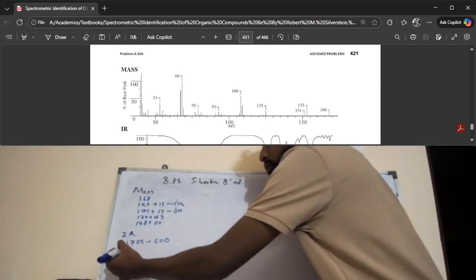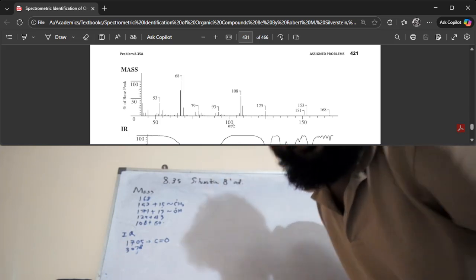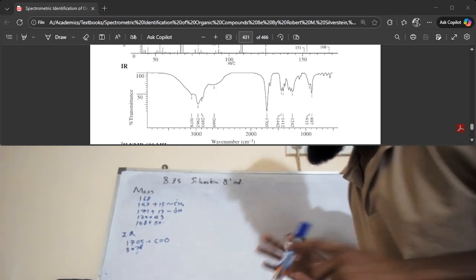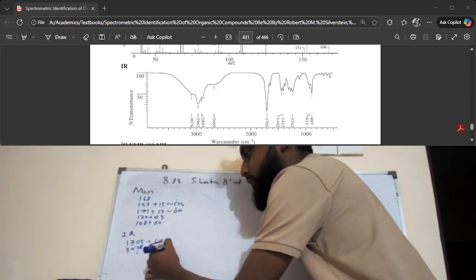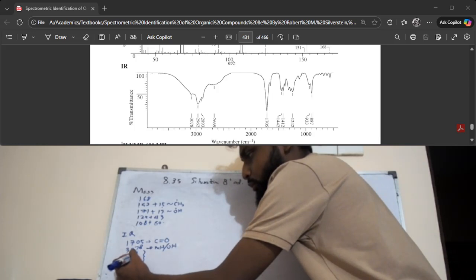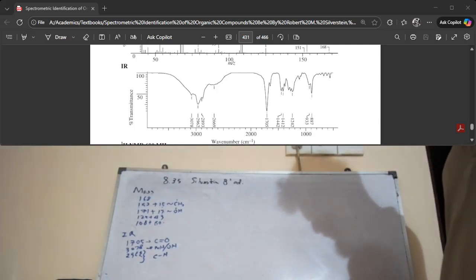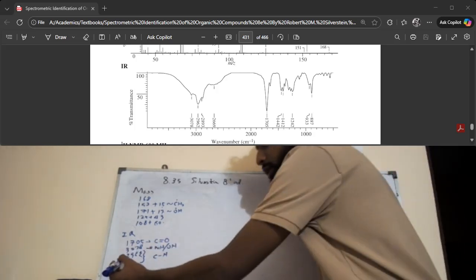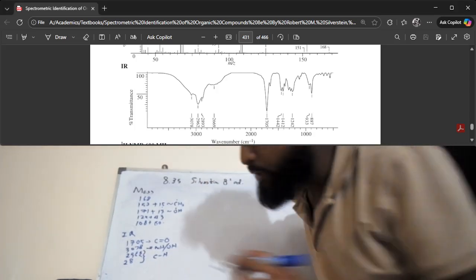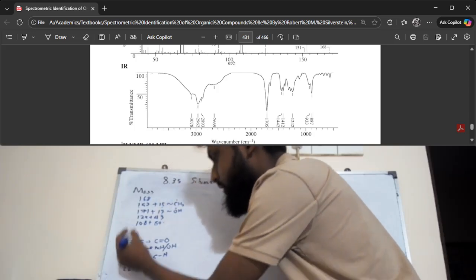There are a bunch of other peaks in the 3000 to 2000 range. I'll scroll up here a little bit to bring the IR into view. As you can see, there's a very broad peak there, which maybe means there's an NH or an OH bond, and the other peaks at about 2962 may be various CH bonds. So we are going to leave it there. But as a general practice, I'm going to write the peak values: 2893, and then 2669. These are the IR peaks.